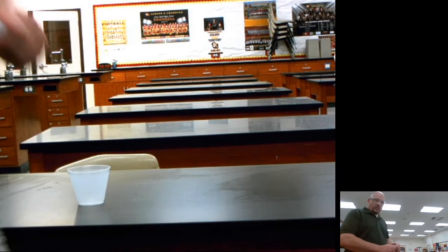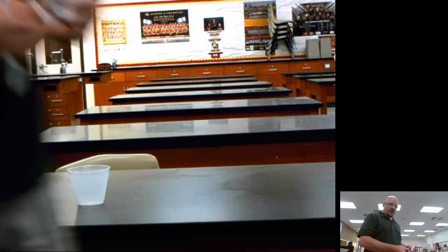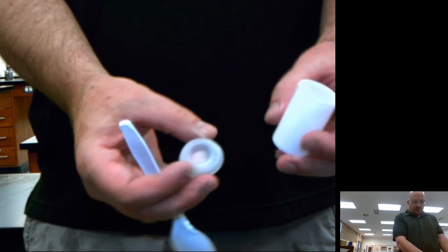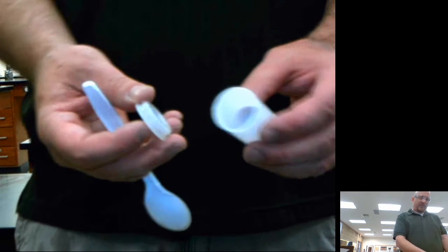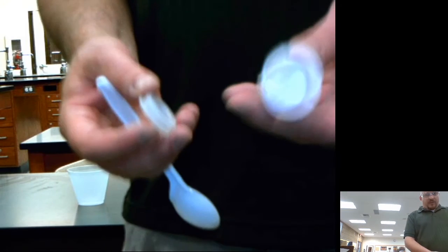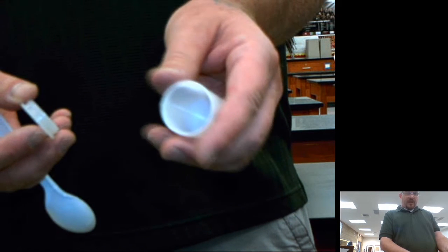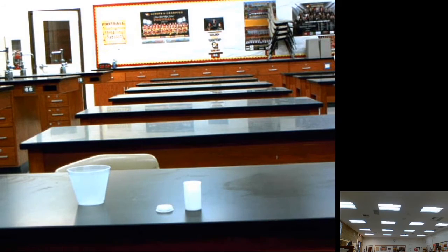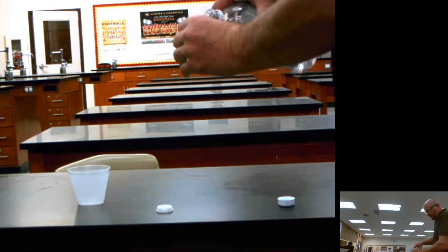For example number 2, we have just a run-of-the-mill film canister. You all may not even know what these things are. Maybe you haven't seen one before, but way back in the day before cell phones and digital cameras, you had film that came in canisters looking like this. If you take Mr. Fran's photography class, you definitely will see one of these. This is what they call a film canister. And into this canister, I am going to pour a little bit of liquid.